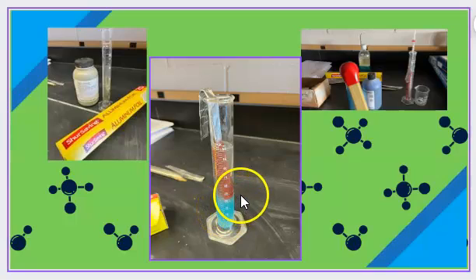It's a little hard to see in my picture but you can see where the aluminum foil stops. This top solution now is going to be clear because it's the aluminum ions in solution and not the copper ions and down here it's remaining blue. Great demonstration or you could use it as a lab. All of these things you can set them up have them in your box and every year when you're talking about matter or matter and energy you can bring them out for the students.